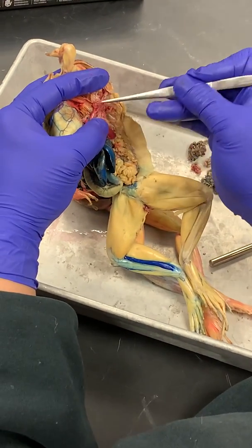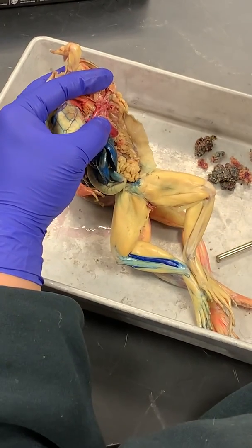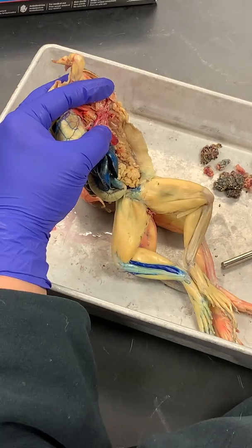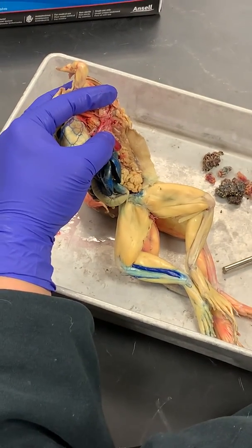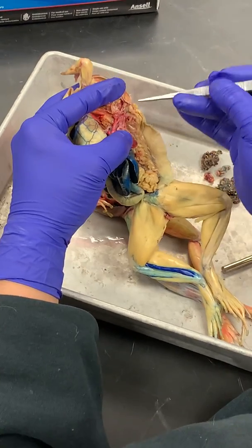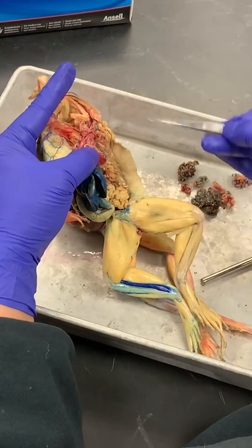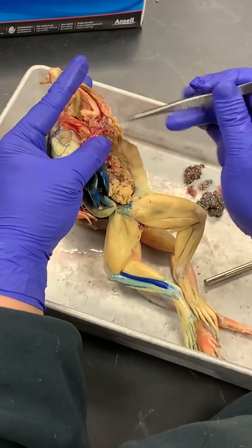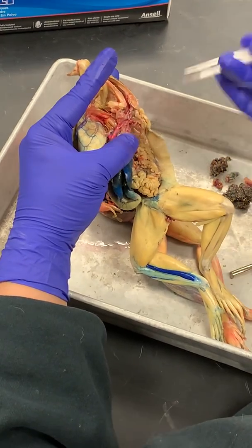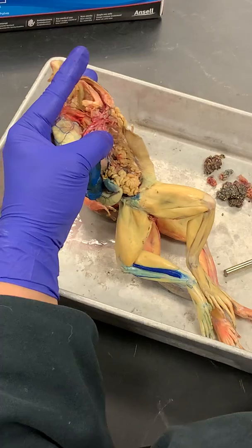This bulb is called the carotid body, and it contains all these sensory receptors for pressure, oxygen, carbon dioxide, pH, and stuff like that, because the internal carotid artery is going to dive deep and medial and head directly up to the brain. So having these sensory receptors there are going to make sure that the brain is getting all the right oxygen and pressure.